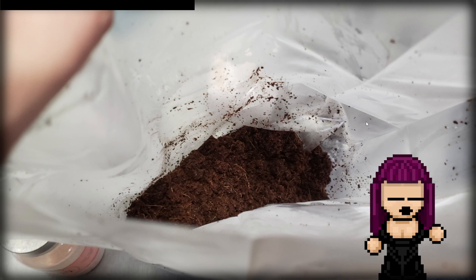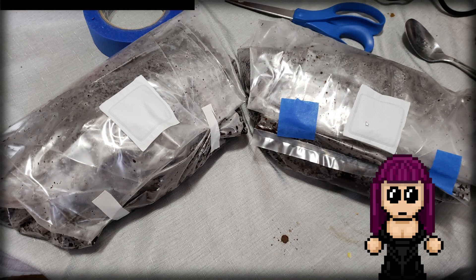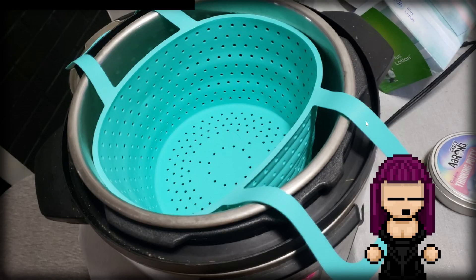I put it in bags and folded them up. I realized partway through this experiment I was missing a few things I didn't prepare for — like high-heat tape or sterilizing-safe tape. So I just used whatever I had, which was painter's tape, which actually worked really well, and white duct tape, which kind of melted but truthfully held through the process. I didn't do really full bags, and obviously my bag folding skills have yet to be fully honed.